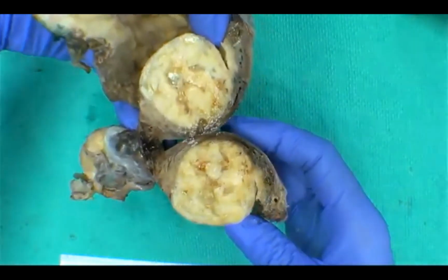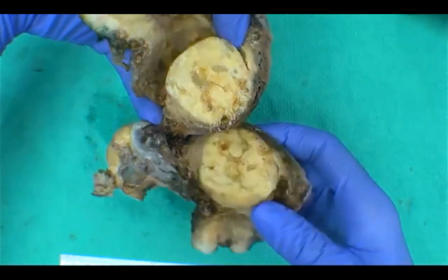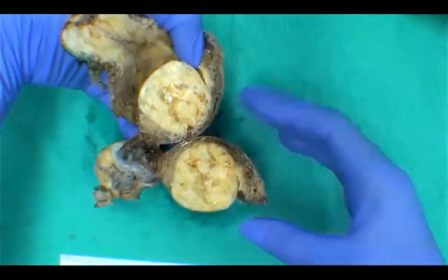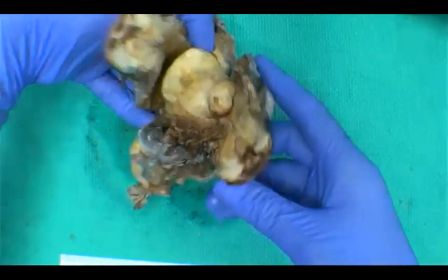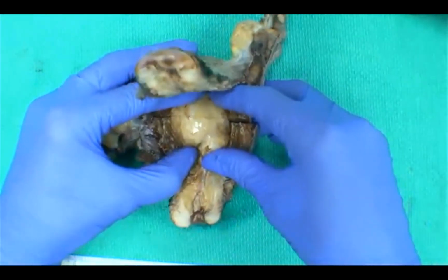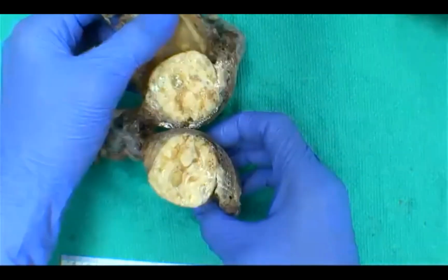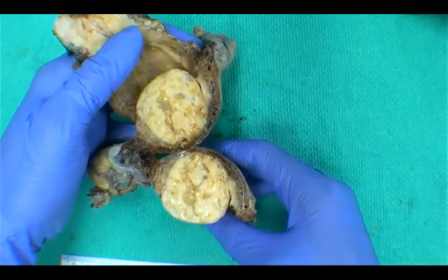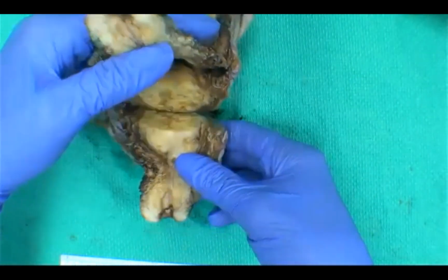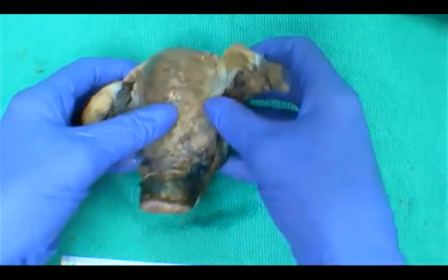If you are suspecting that this is possibly a malignant nodule, additionally, you'd want to measure the nodule to your nearest paracervical margin and to the vaginal cuff margin. In terms of sectioning, regular fibroids, it would just be a couple representative sections, and you want to show any areas that are degenerated. If you're suspecting something that might be a malignancy, probably opt to do maybe 1 per centimeter.